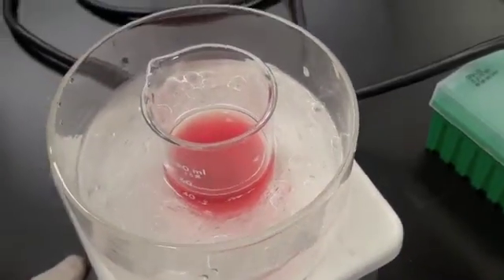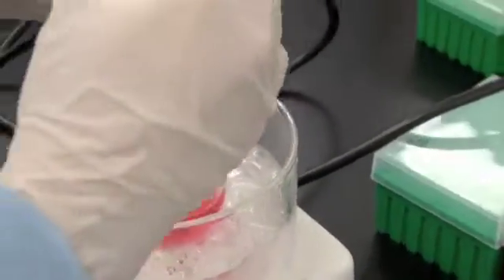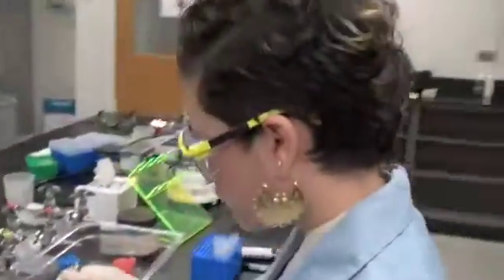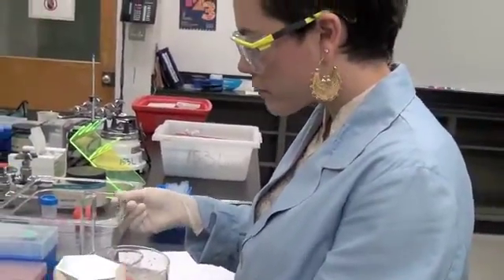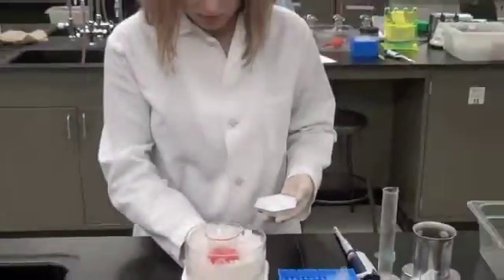And Biochemist Dicer already has her crude in the beaker, and is spinning the solution gently to avoid surface air denaturation. Oh, that makes me dizzy. So true, but that doesn't affect Biochemist Dicer. Watch how she slowly adds the salt to the crude extract in small increments. Biochemist Dicer will add the salt slowly over a 10-minute period to avoid the creation of concentrated microenvironments that may lead to unintended LDH precipitation.